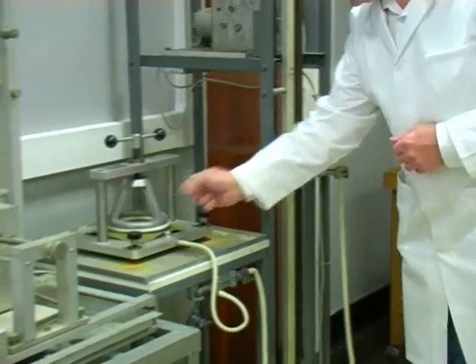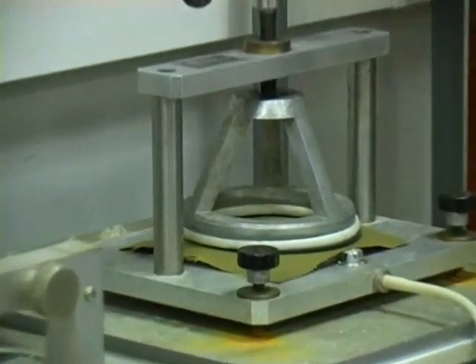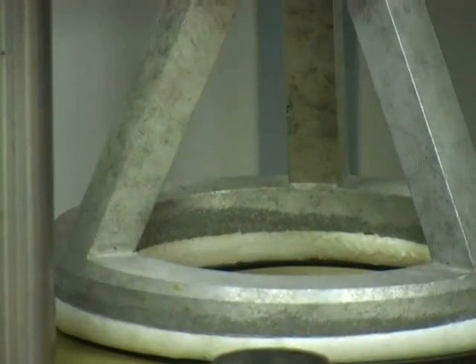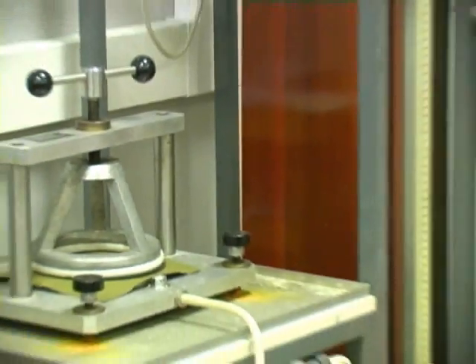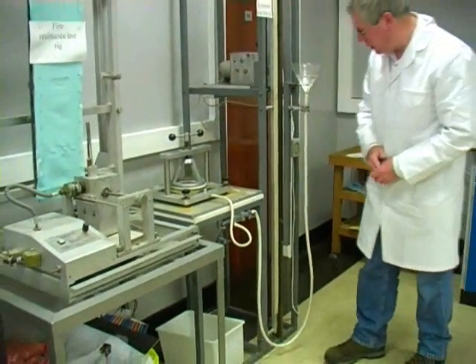Now, what we look for in this test is three drops of water on the back of the fabric, which is the top of the fabric as we look at it here. And down here, we've got a meter rule scale up this side. We've got a pointer which indicates the height of the water in centimeters.